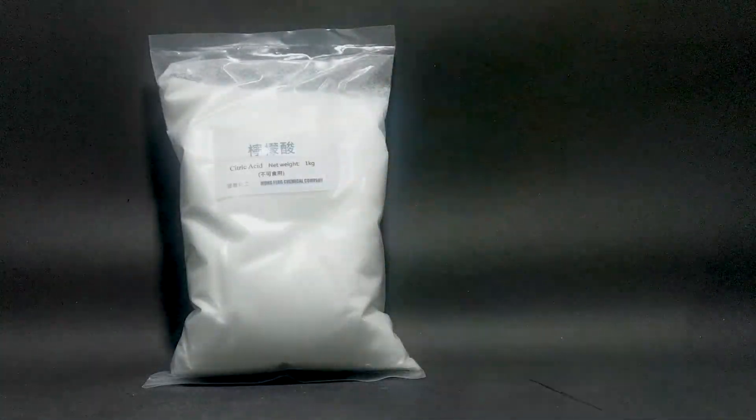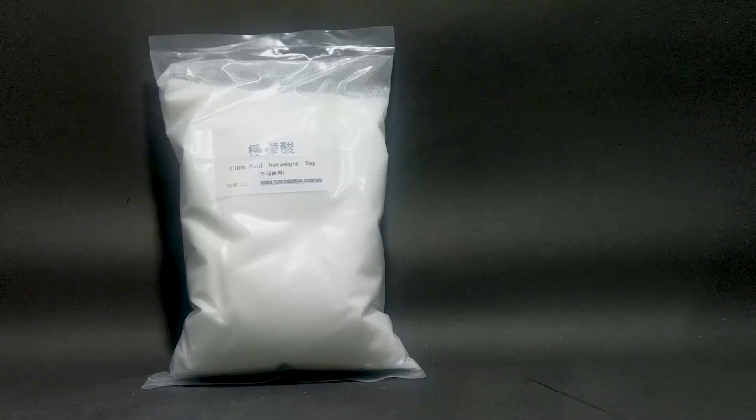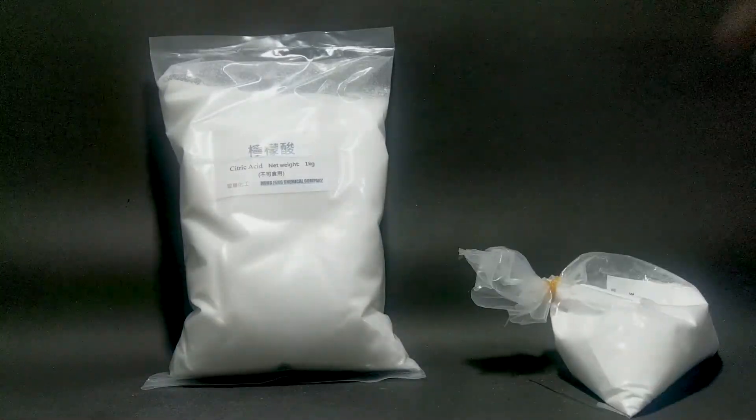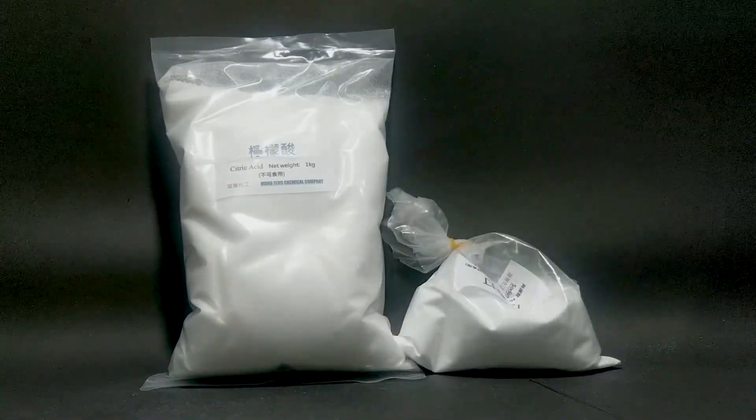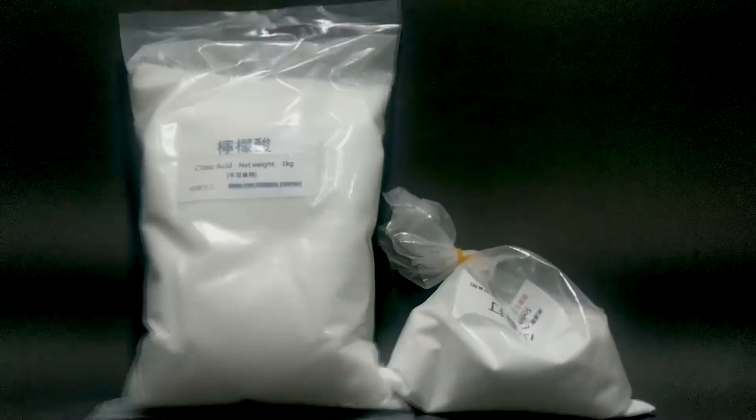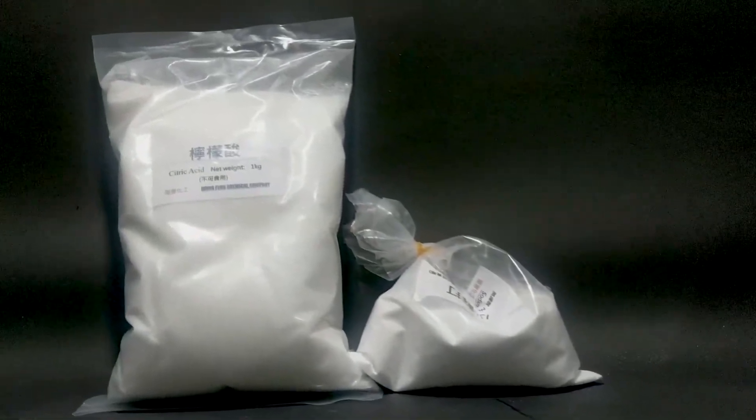I make my sodium carbonate from decomposition of sodium bicarbonate, aka baking soda. Using carbonate instead of bicarbonate is because it can reduce the emission of CO2, therefore reducing the chance of encountering foaming issues.